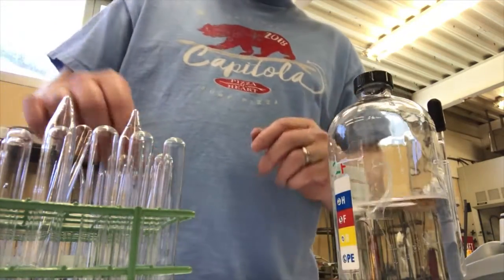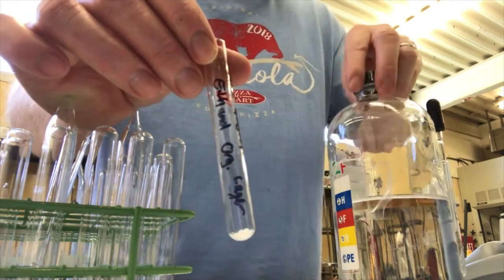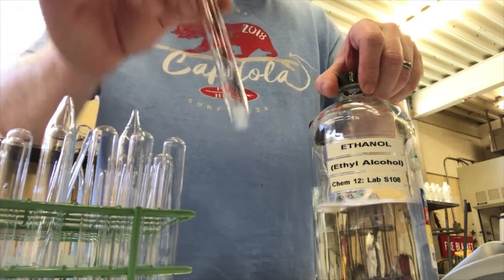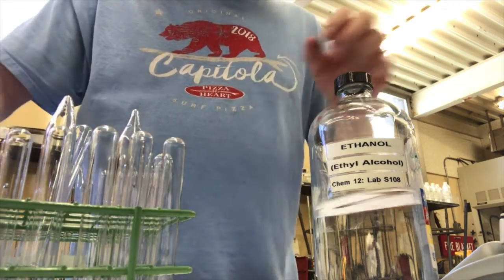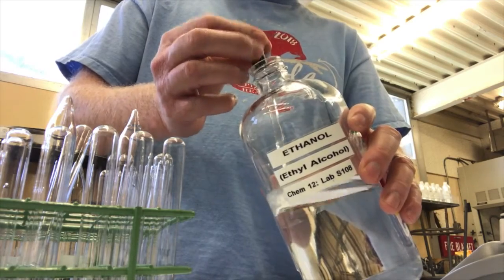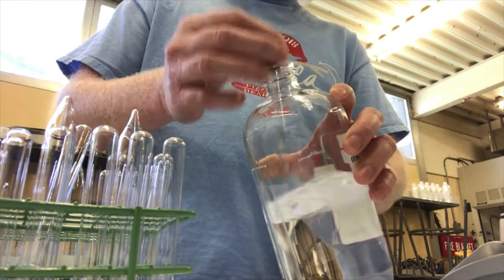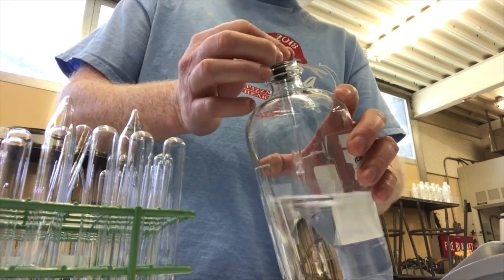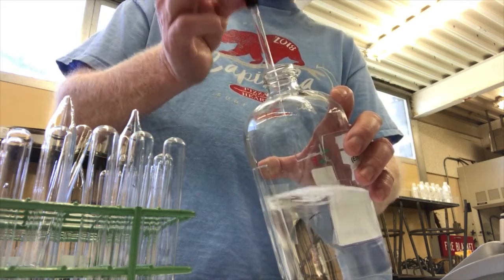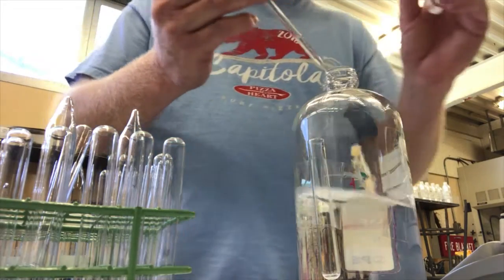So the first thing I'm going to check is ethanol. I've got to make sure I have the right tube. See how it says ethanol? And this says ethanol. So I'll do that one first. I'm going to pipette out some ethanol and then push it right back in the bottle. Pipette some up, push it back in the bottle. This way I can get this pipette evaporatively cooled and it won't drip as much on me.